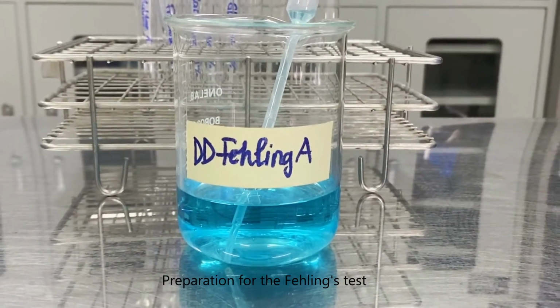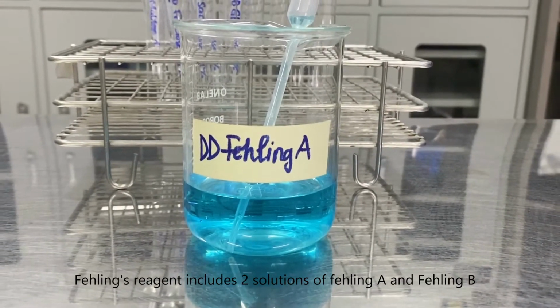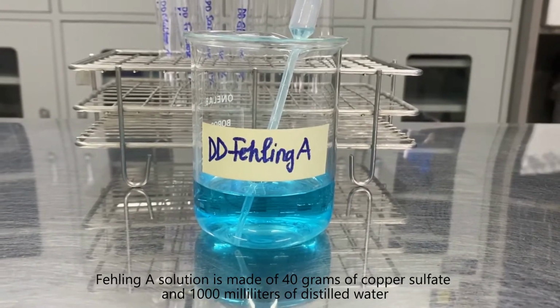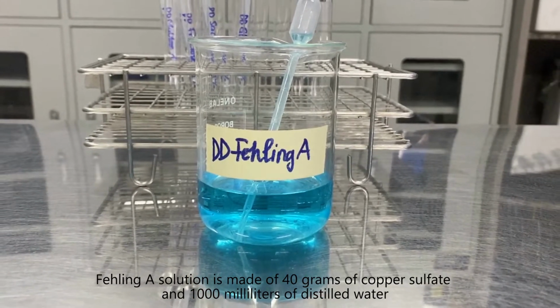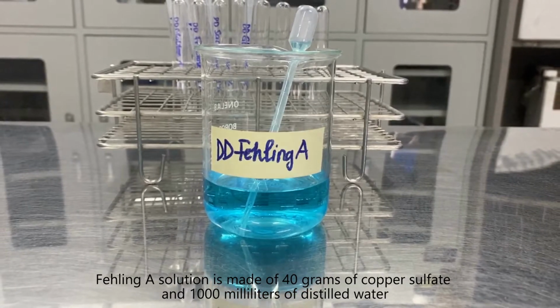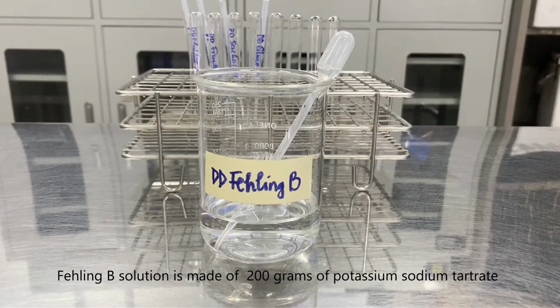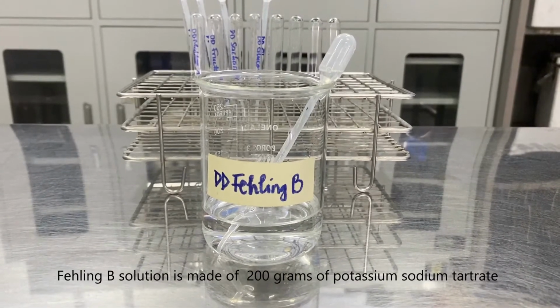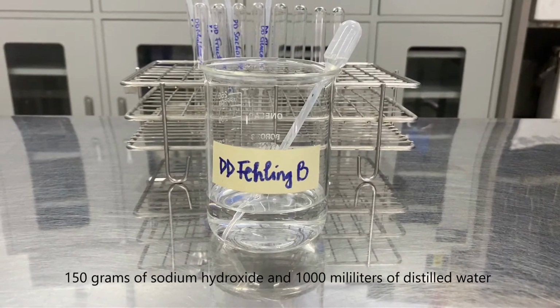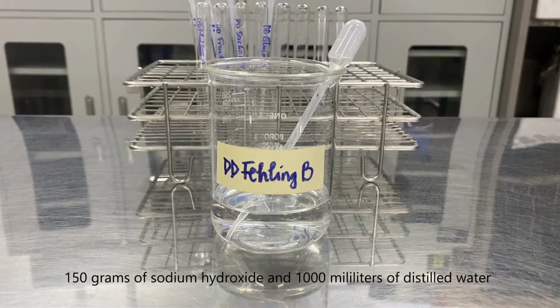Preparation for the Fehling's test. Fehling's reagent includes two solutions, Fehling A and Fehling B. Fehling A solution is made of 40 grams of copper sulfate and 1,000 milliliters of distilled water. Fehling B solution is made of 200 grams of potassium sodium tartrate, 150 grams of sodium hydroxide, and 1,000 milliliters of distilled water.